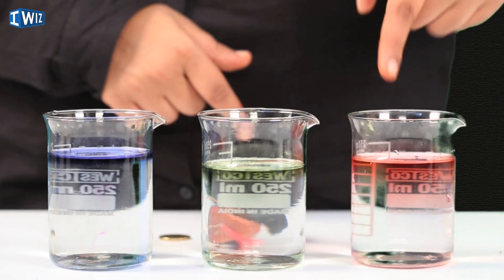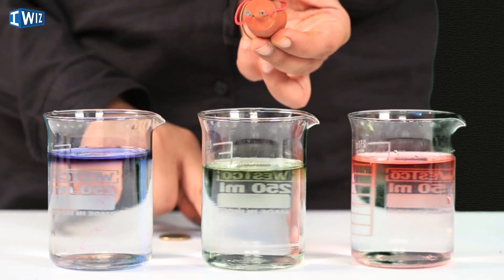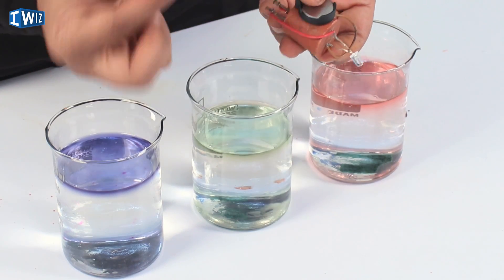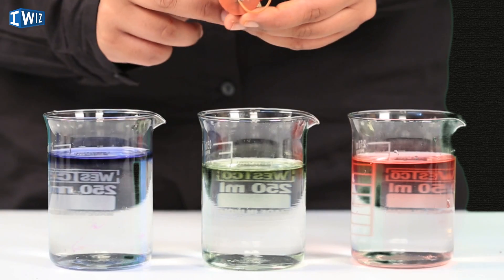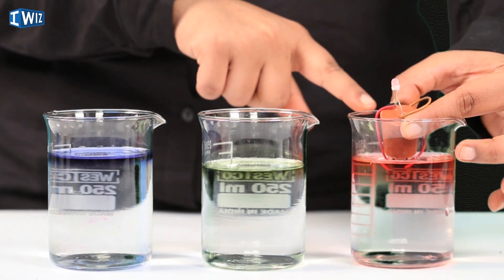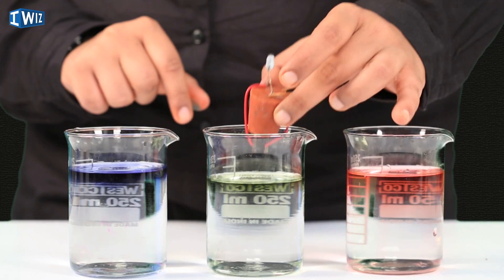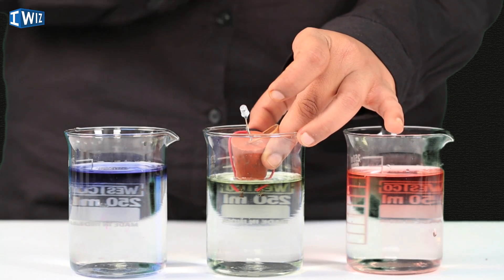So far we've learned that acids are sour and corrosive, and bases are bitter and slippery — but what actually makes an acid an acid and a base a base? I have an acid with universal indicator, a pH-neutral substance (water), and a base. I also have a circuit: when I close it with a metal conductor, it lights up, because electrons — charged particles — easily pass through metal. Now let's check if charged particles in the solutions can close the circuit — dipping it in the acid lights it up, but in the neutral solution the light barely lights up.